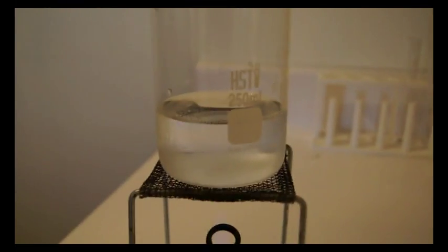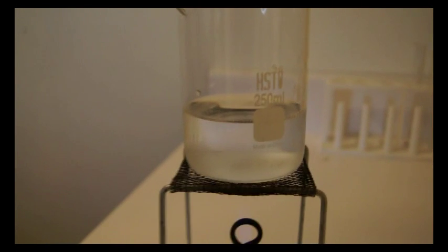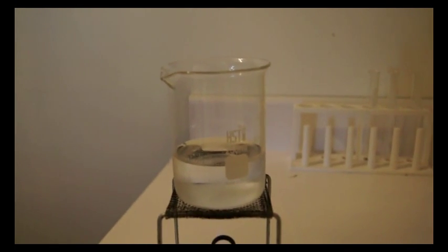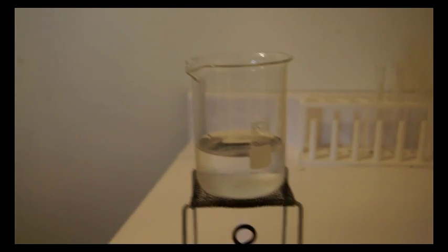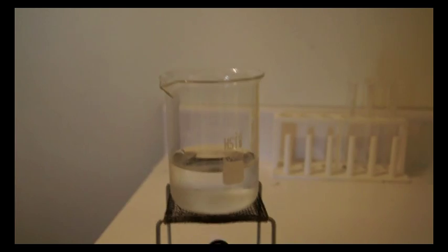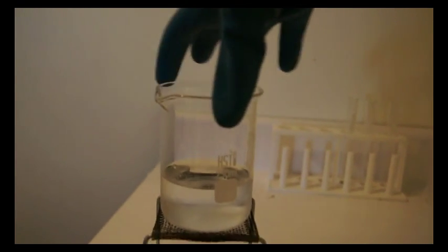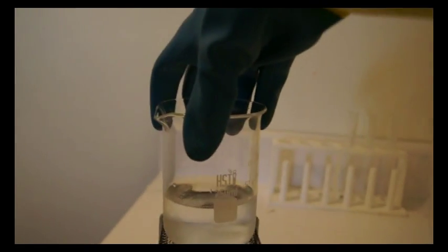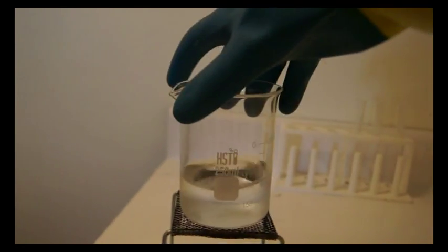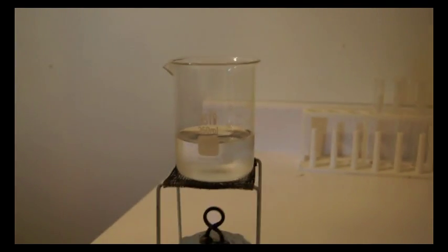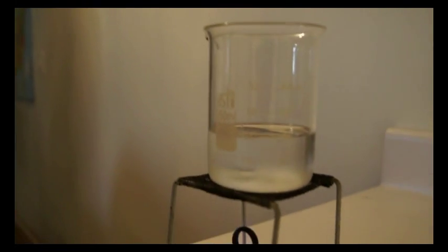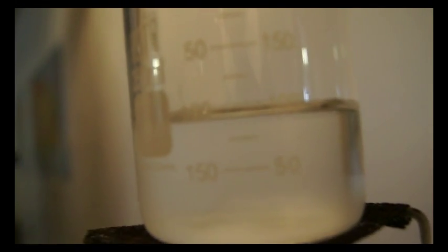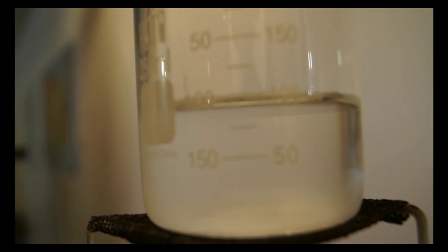So what you want the solution to do is steam, but you don't want it to get to a boil. And if it starts boiling, you just want to pick up the flask on the top and just spin it around. Now I want that 100 milliliter line to probably get down to the 50 milliliter line, so I'll be back when that gets done.